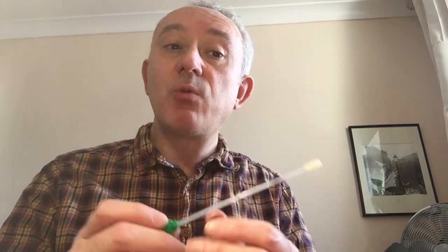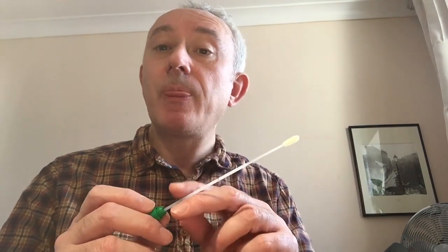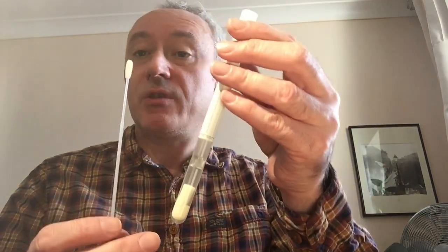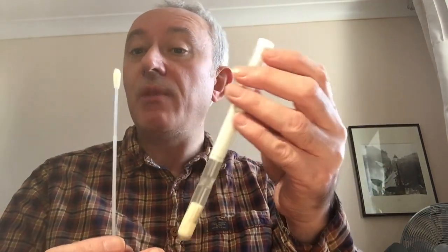There are different ways to enumerate from a swab as well. With the ICR swab, which is a presence/absence swab, we use broth medium and we'd be looking for growth or no growth.